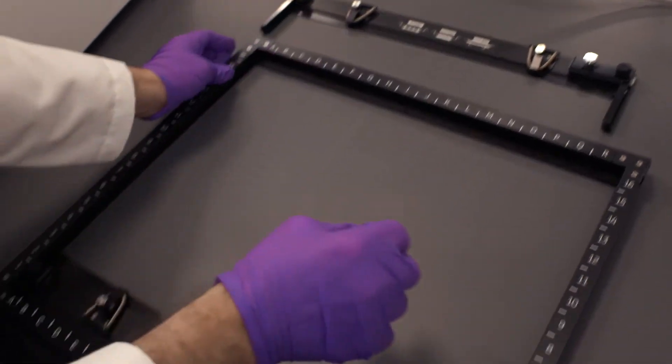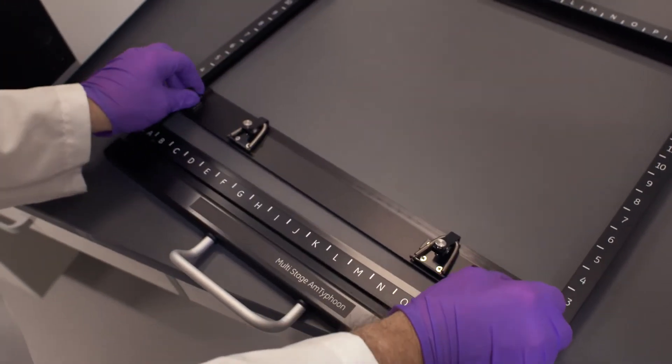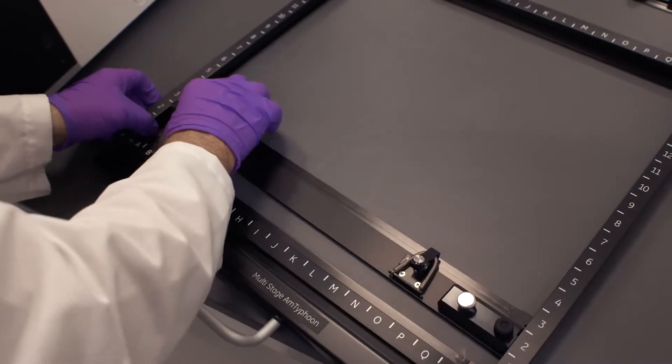So that's the top one done. With the bottom one here, it could be a little bit more tricky.